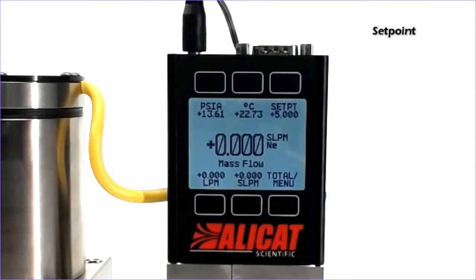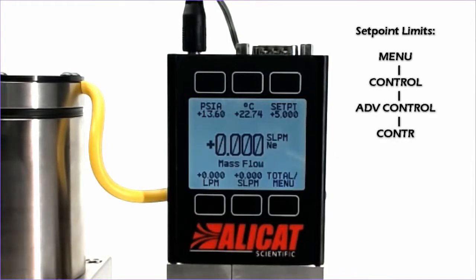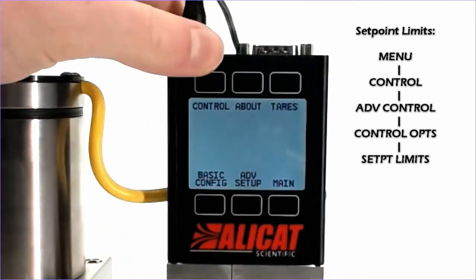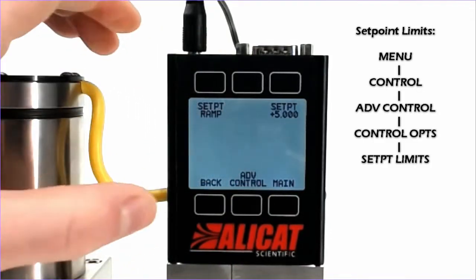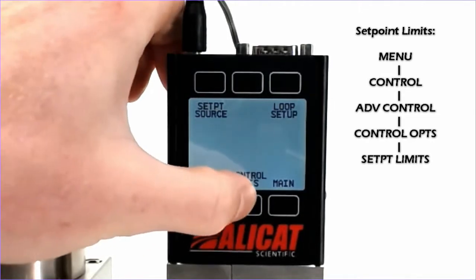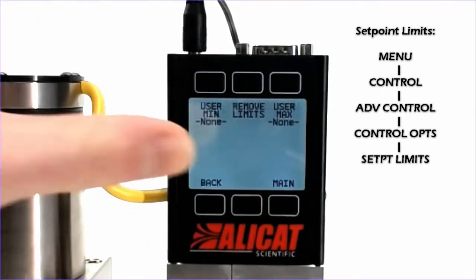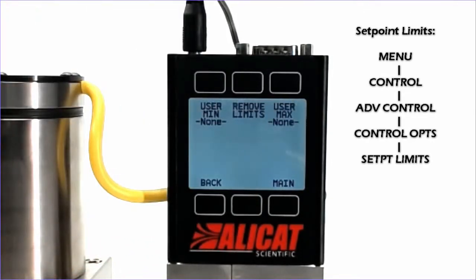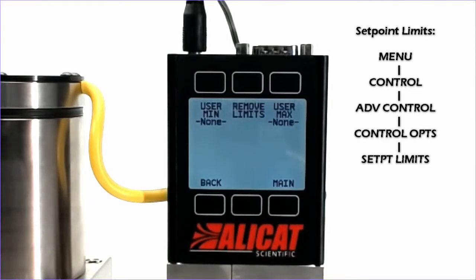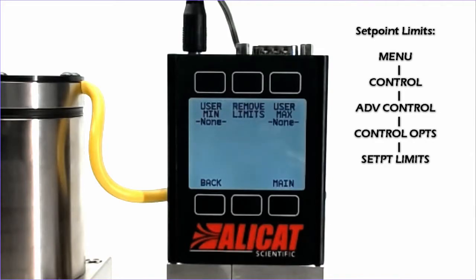If we would like to establish some set point limits within this range, we will go to menu, control, advanced control, control options, and set point limits at the bottom. Now what these limits do is tell the device not to accept a set point if the set point is out of the range of these limits.